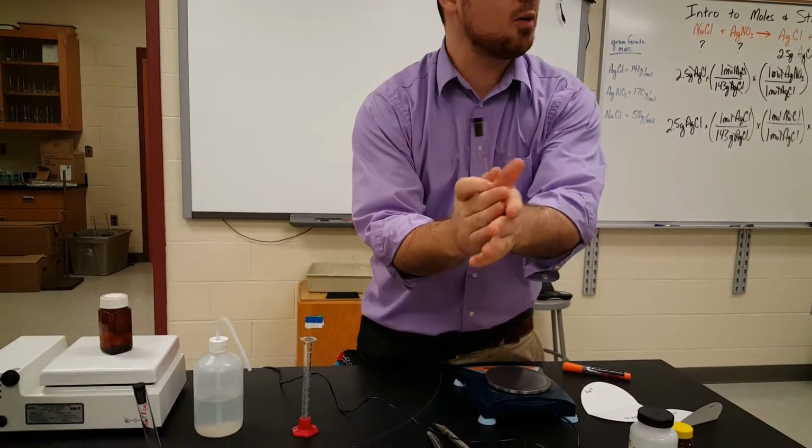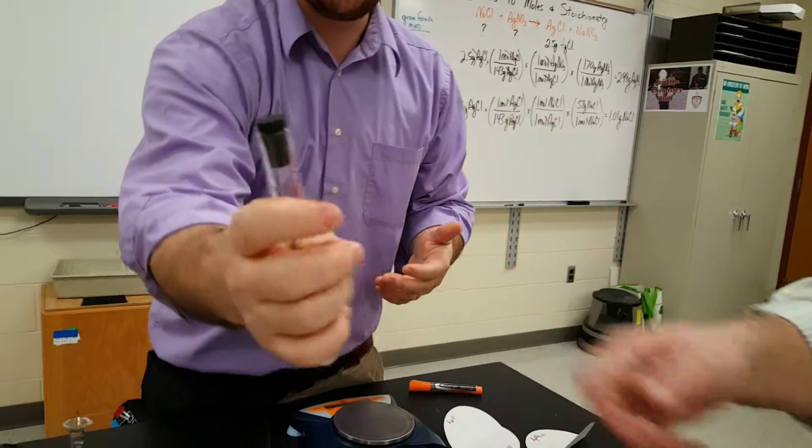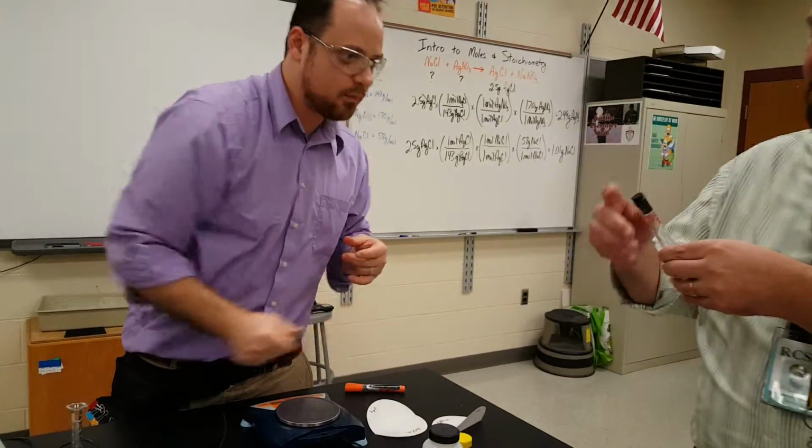Ooh, surprising. Was it hot? No, opposite. Cold? Yeah, that's really cool. Endothermic reaction. Plugged it up. Mr. Milks is going to shake and dissolve all that while I weigh out the other one. I can do that.